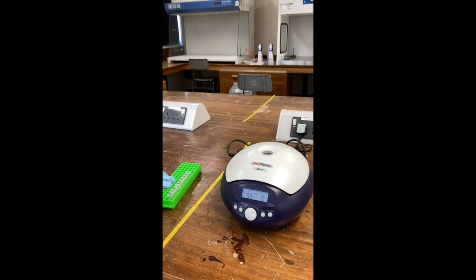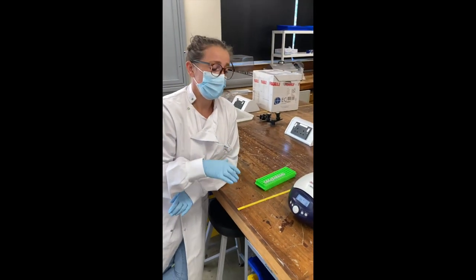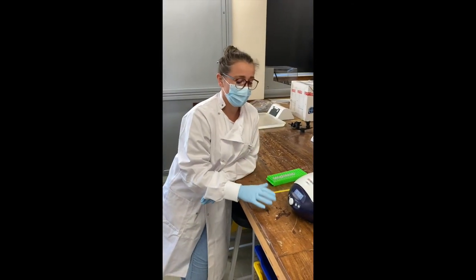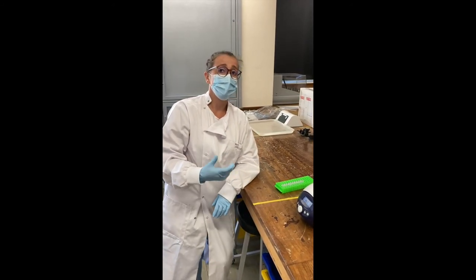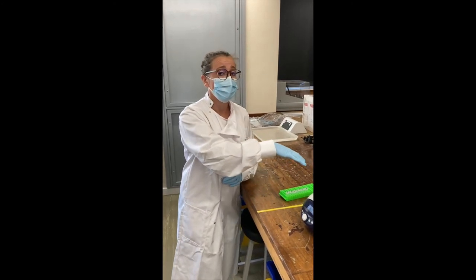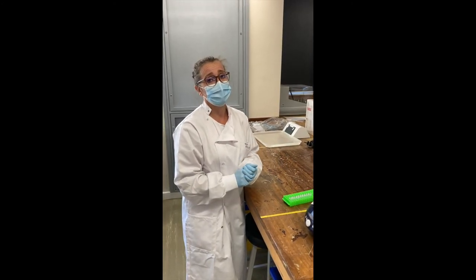It's important to stay with the centrifuge until it reaches its maximum speed. If it makes a loud noise at all or starts to move, press stop, step away from the machine, wait for it to stop, open the door and have a look at what's gone. Normally it would be the lid isn't on properly or you haven't balanced the setup correctly.